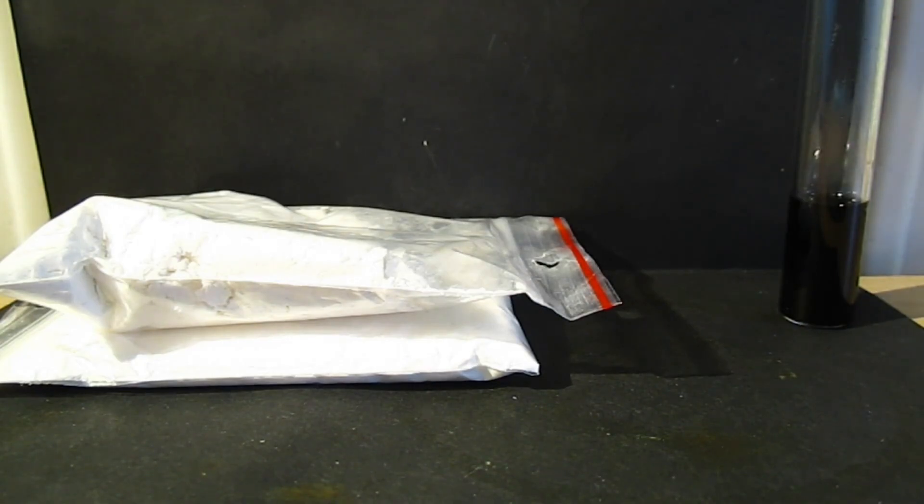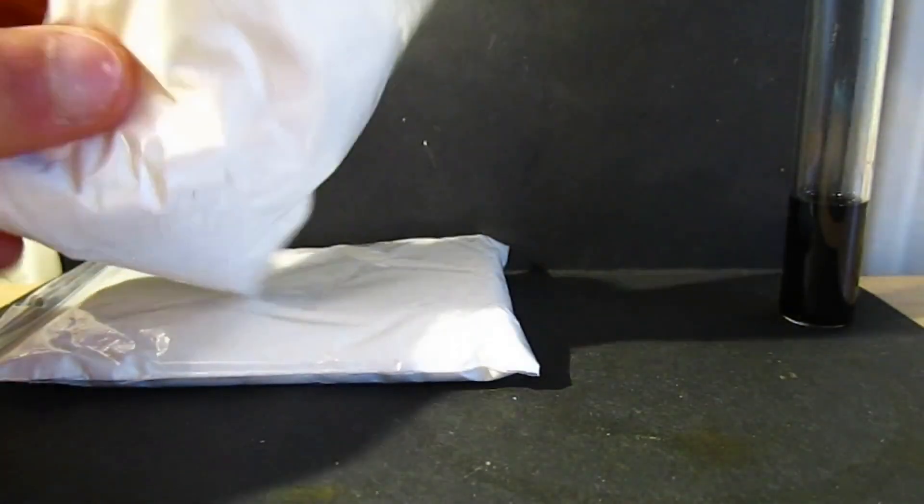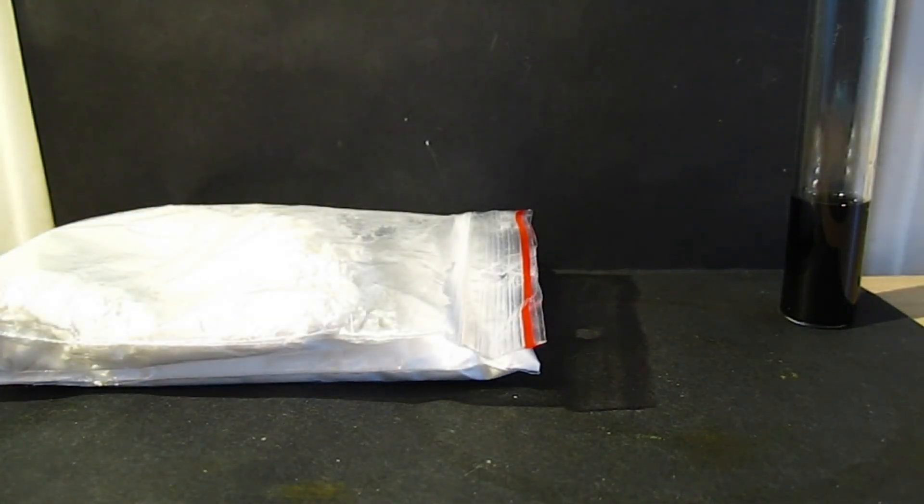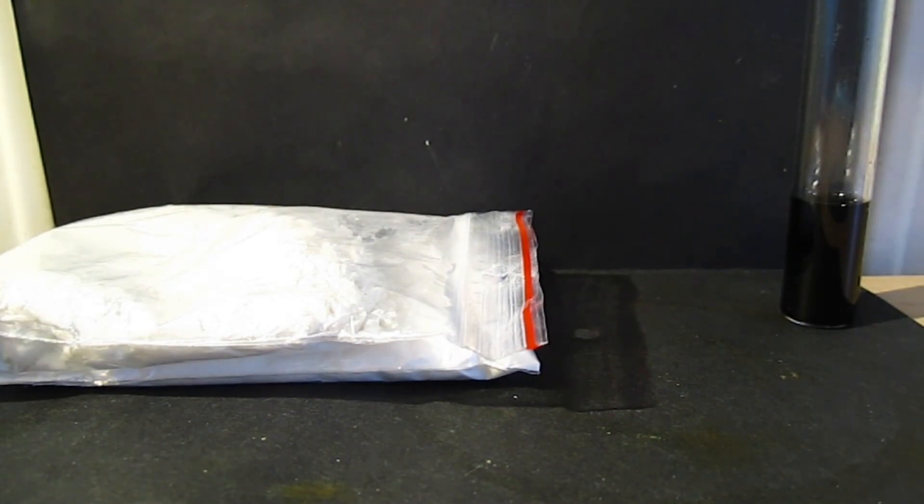In today's episode I'm going to show you how to make this black ink. I actually bought this extract, and you might ask why did I buy it when I can just go into the wild and collect some galls. The reason is because it's winter and it's pretty hard to find these gall apples in the winter, so I just opted to buy some.